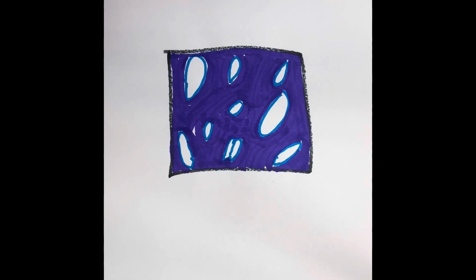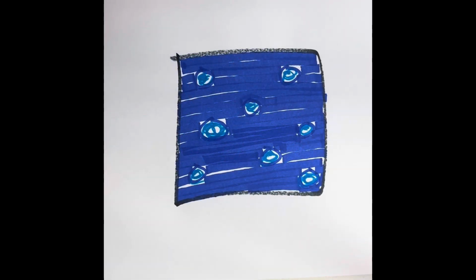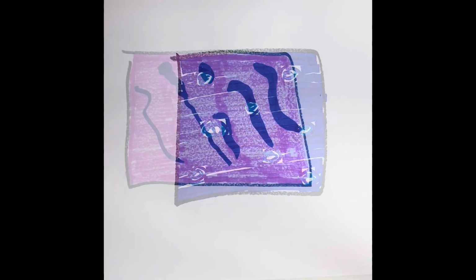This is a cartilage connective tissue. This is hyaline. Hyaline has a glassy-like appearance due to all of the collagen fibers. It's used at the ends of bones to minimize friction, and it is used in the fetal skeleton. Here's another cartilage connective tissue. This is elastic cartilage. It has some elasticity due to having elastic and collagen fibers. It's found in the external ear and also in the epiglottis in the throat.